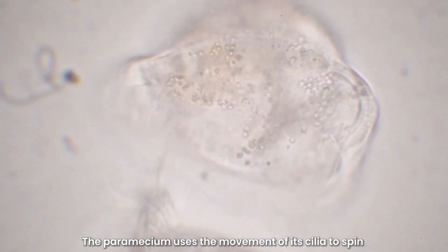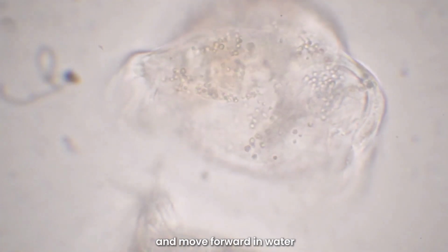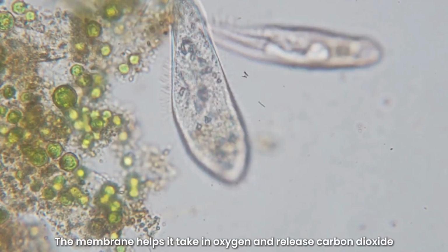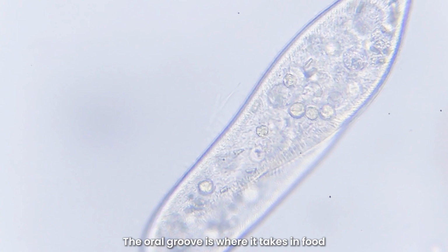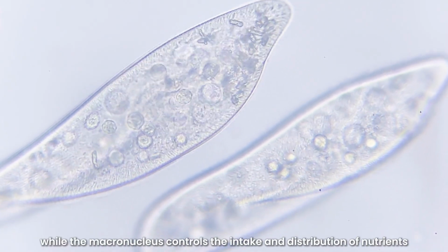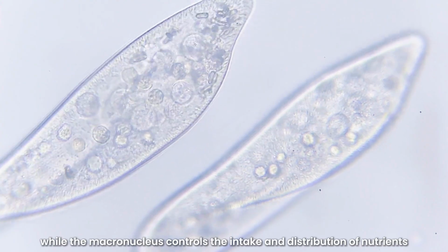The paramecium uses the movement of its cilia to spin and move forward in water. The membrane helps it take in oxygen and release carbon dioxide. The oral groove is where it takes in food. The micronucleus contains genetic material, while the macronucleus controls the intake and distribution of nutrients.